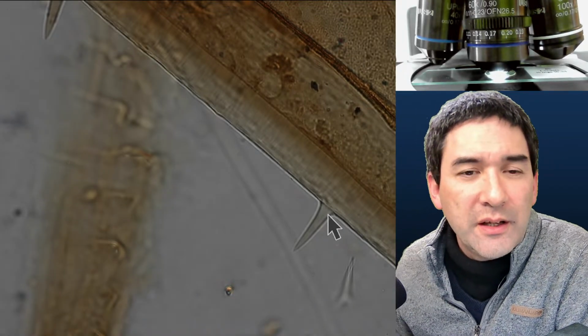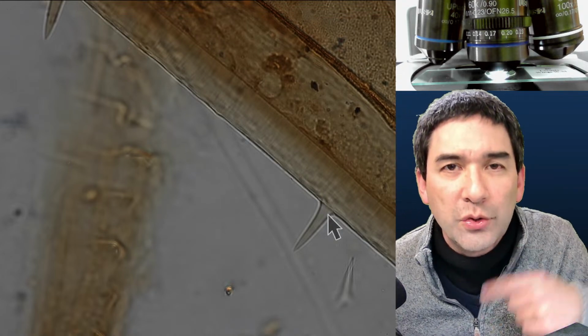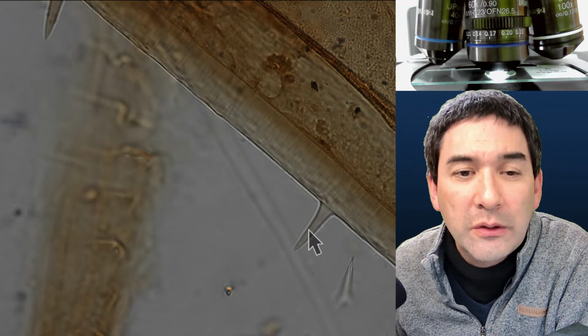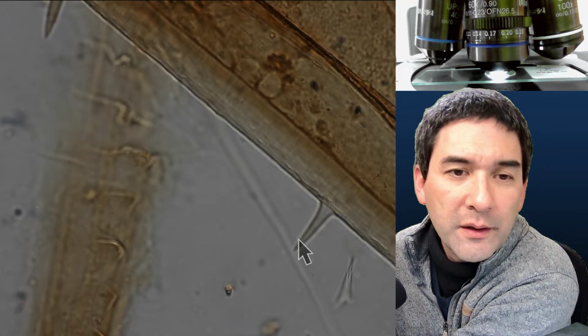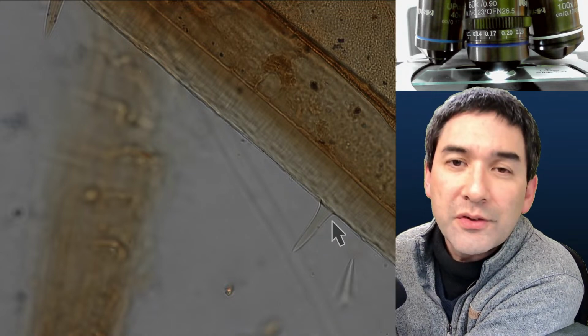Another thing I want to say is that because I'm recording this on a camera and it goes over YouTube with some compression going on, the clarity might not be the same as when looking directly through the objectives. But generally speaking, the further you go up with the magnification, the more blurry the image appears.